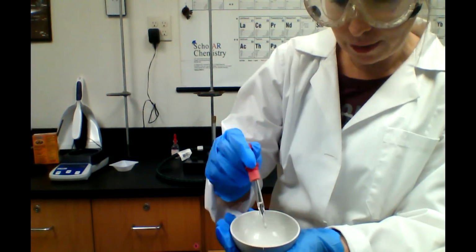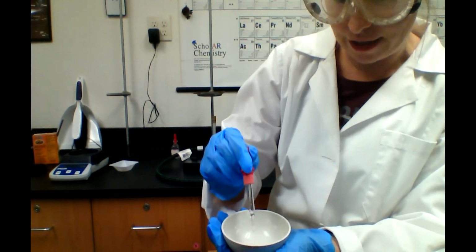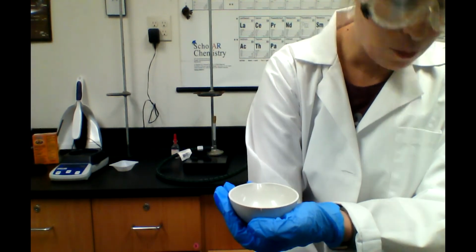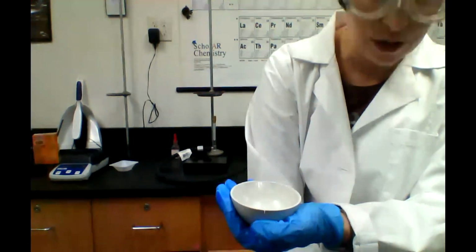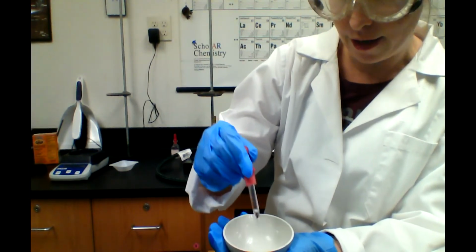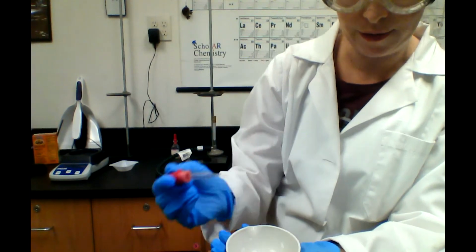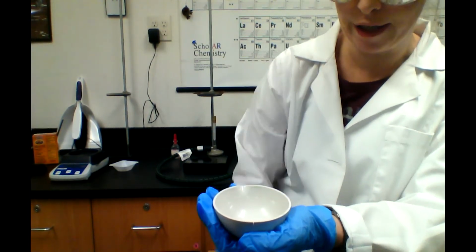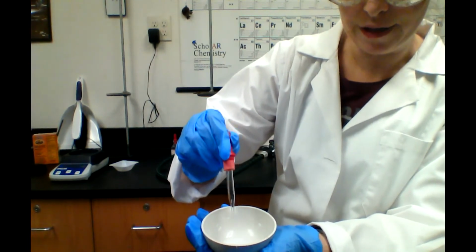So I can also tell by appearance when the reaction is over, when all the baking soda is gone. If you guys would like to try a version of this, I'm using HCl because it's more concentrated and it's a faster reaction, but you guys can go ahead and just mix vinegar and baking soda and you're seeing a very, very similar reaction to this. Okay. I hope you guys can hear the bubbling of this. It's still going.